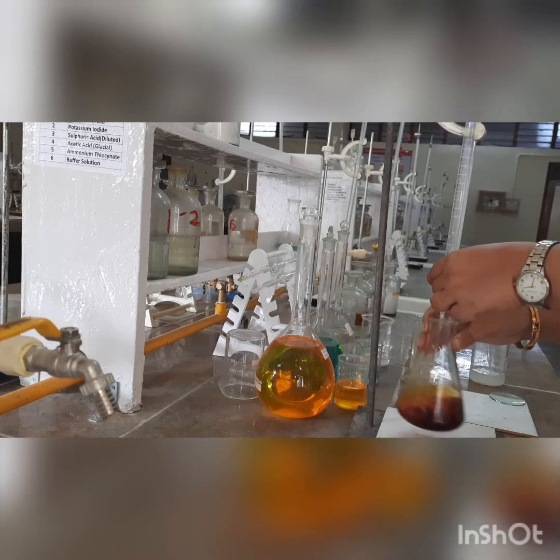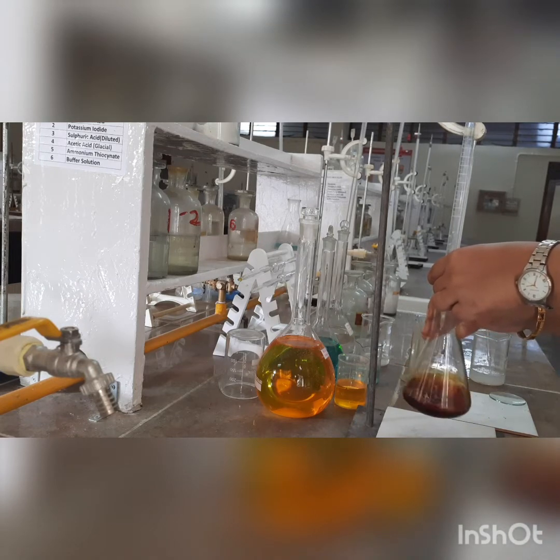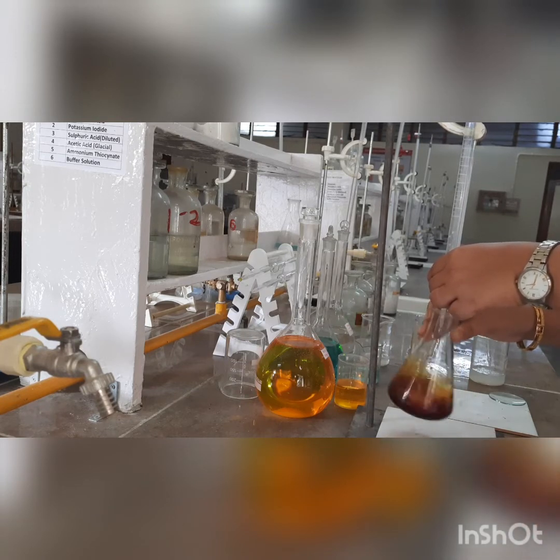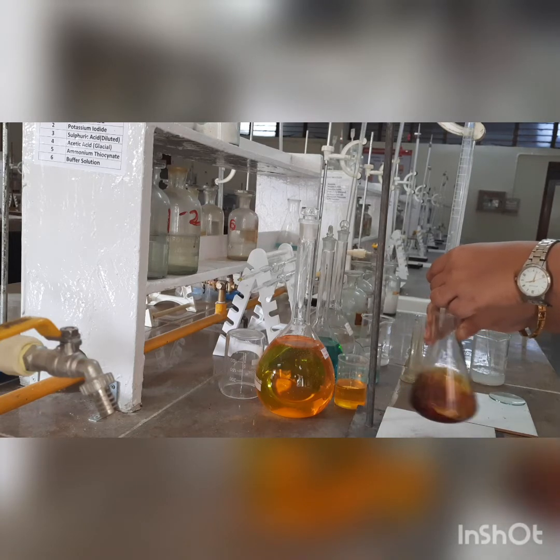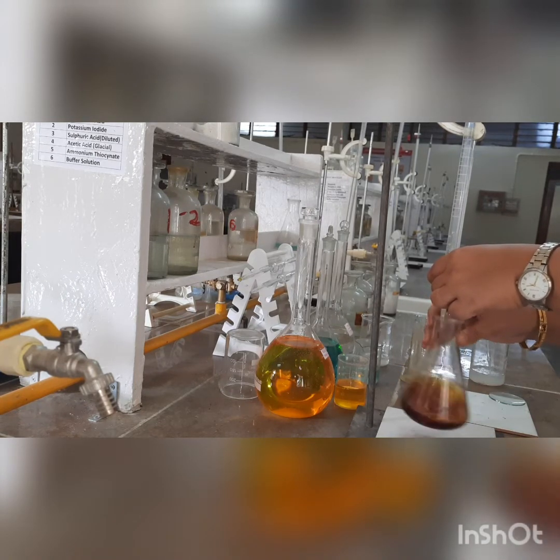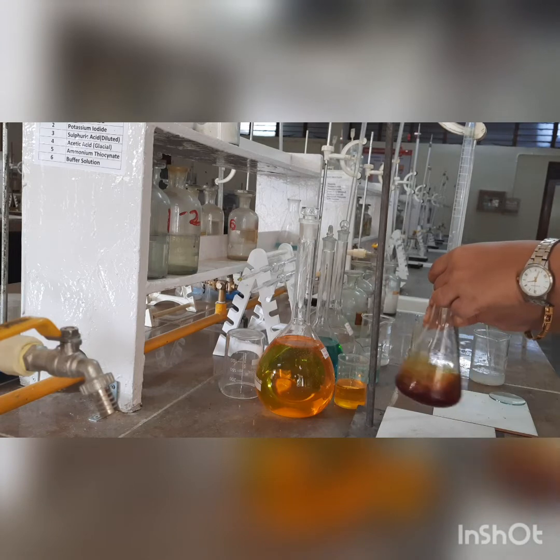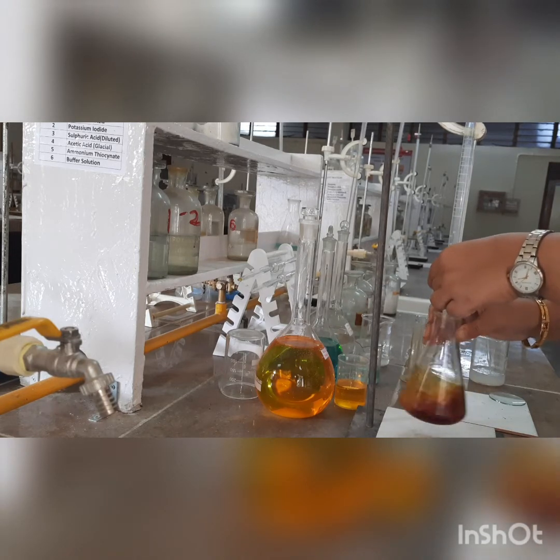What we are doing right now is titrating the solution. When we are going to add the starch is after the solution of K₂Cr₂O₇ reduces in color — as the color diminishes a little and becomes a little paler — then we are going to add the starch solution. Hypo is added from the burette dropwise. As we need to standardize hypo, therefore the solution is kept in the burette. Whichever solution needs to be standardized is always in the burette. The solution color is diminishing — it is becoming pale — so it is now time to add the starch indicator.